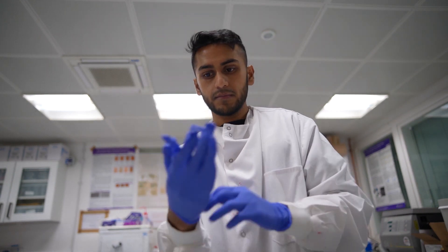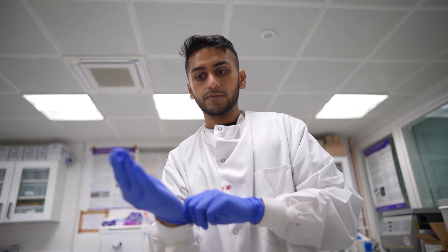It's very important that you get all the buttons on your lab coat, just to make sure you're protected from throat to wherever the lab coat ends, because sometimes lab coats are longer and sometimes shorter. Next I need to get my gloves on. Now that my gloves are on we can continue with the experiment.